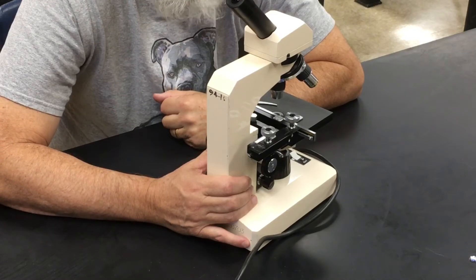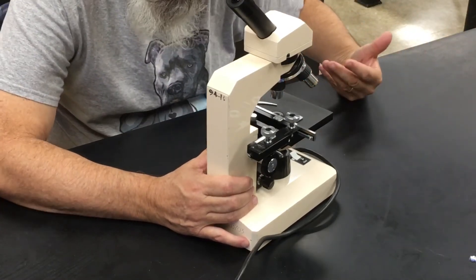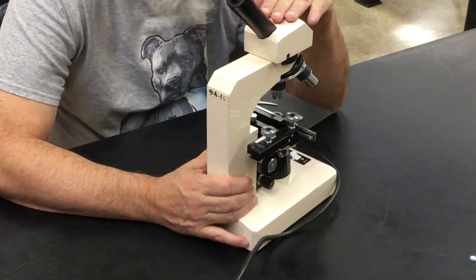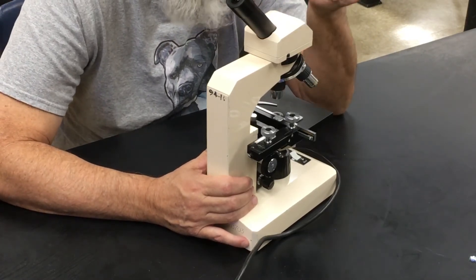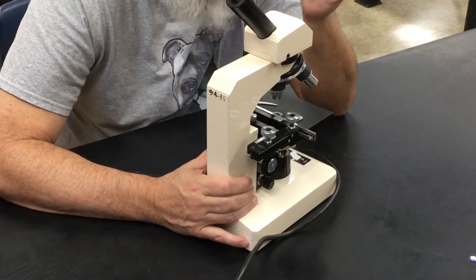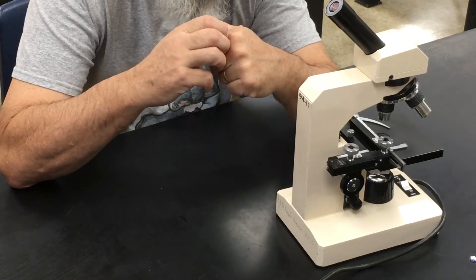In normal instruction mode, each of you would have a seat number that corresponds to the microscope you use, so you'd use the same microscope every time you do a microscope lab.